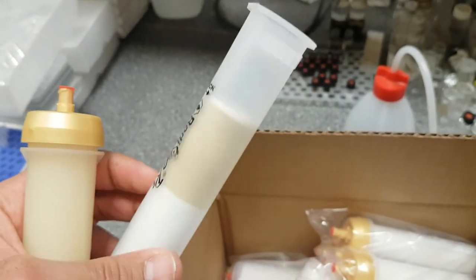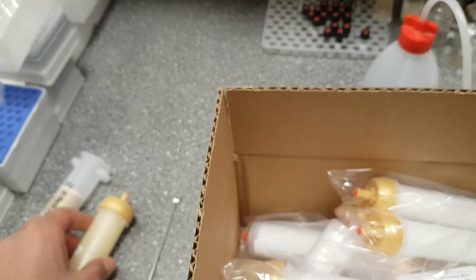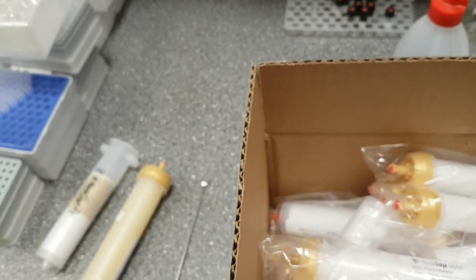I have here around 2 grams from my material. But bear in mind, if your mixture is very complex, you need to use a big one. If it is easy, you can use a small one.